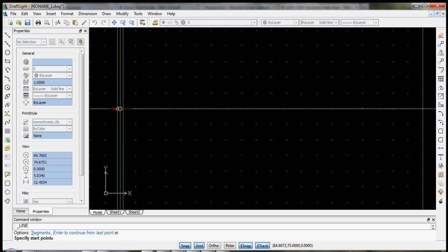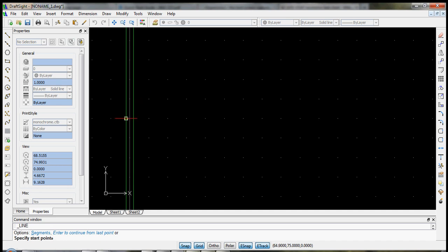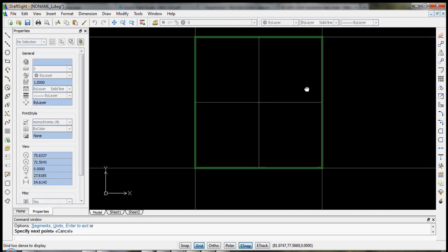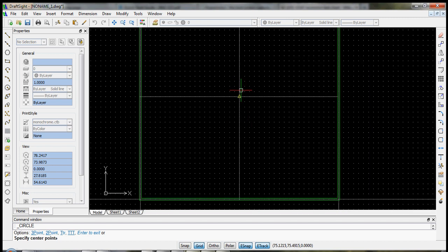Zoom in a little bit closer. You can see now the snapping to the grid actually is interfering with snapping to the object. So let's turn off the snap to grid for a moment. And now we can more easily select the midpoint with the square. Okay, so our goal here is to create a microfluidic pattern, a microfluidic droplet generator that has 4 different fluidic inlets. They are composed of a 1 millimeter diameter circle. And now let's snap back again.